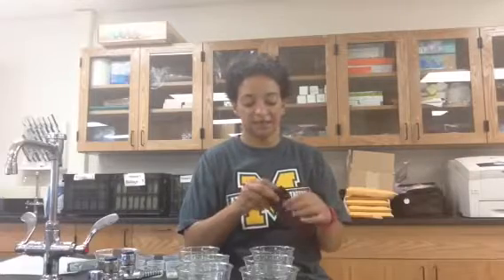The first thing I'm going to do is find my organizational chart, which should be at your lab station, and take out 6 of my glucose test strips. I'm just going to test one for now, but you will take out 6. Make sure you don't touch the testing end of these strips, so it doesn't mess up the results. You'll notice that it is yellow right now. I'm going to test each of these little cups to see if there's glucose present.